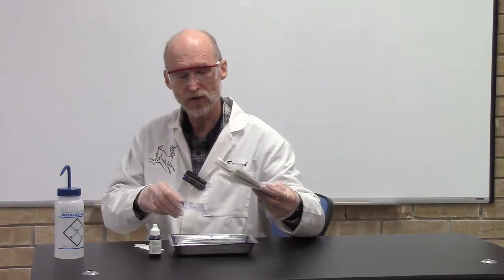Finally, we're going to blot all the excess moisture. So take your bibulous paper, place your slide within it, and gently press on it. And you'll have to move the slide throughout the bibulous paper two or three times to make sure that you get all the excess moisture.